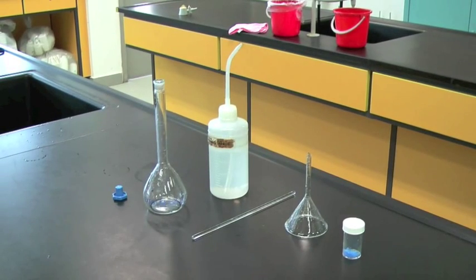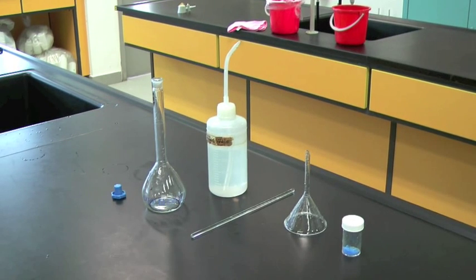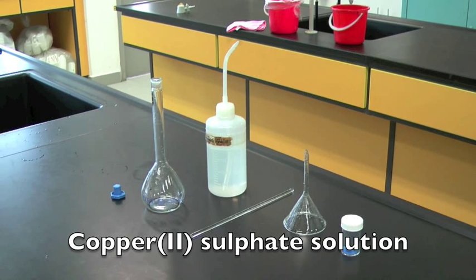These are the apparatus required to prepare standard solutions. Here, we are preparing copper sulfate solution.